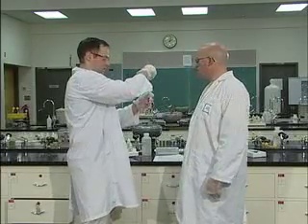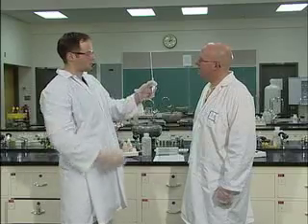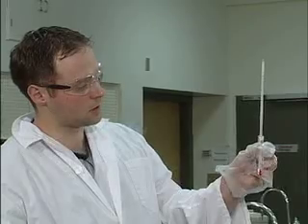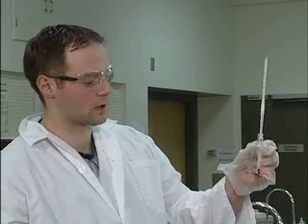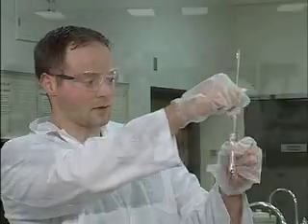Now you're going to check the temperature again. Oh, it's zooming up there. We definitely have a temperature change, up to about 36 degrees centigrade, 37, which is quite a bit warmer than room temperature. And there's no more magnesium in there. The magnesium has gone into solution.